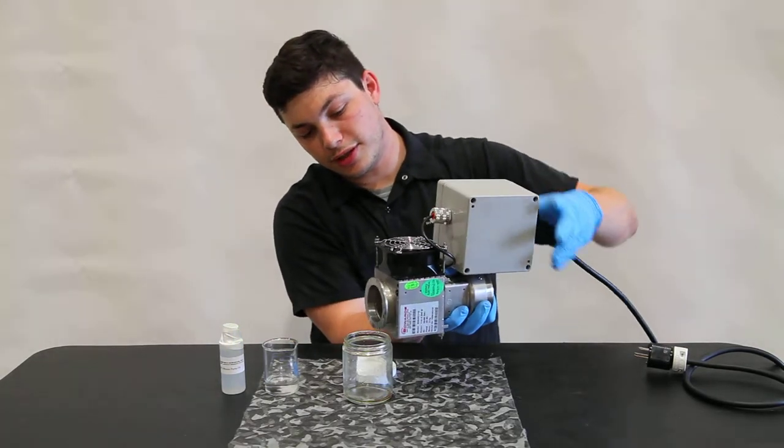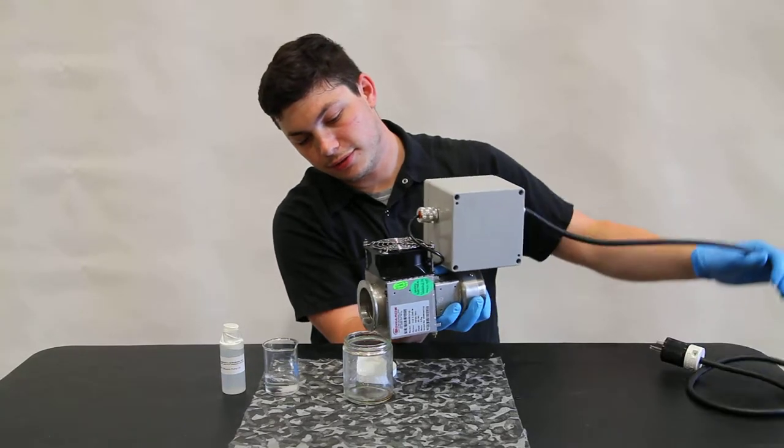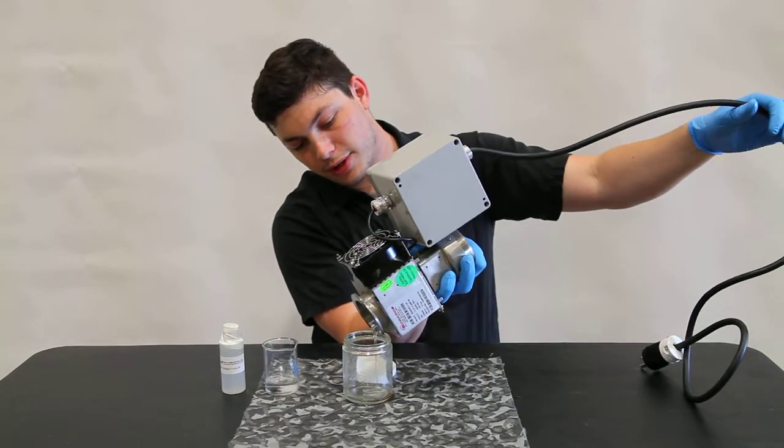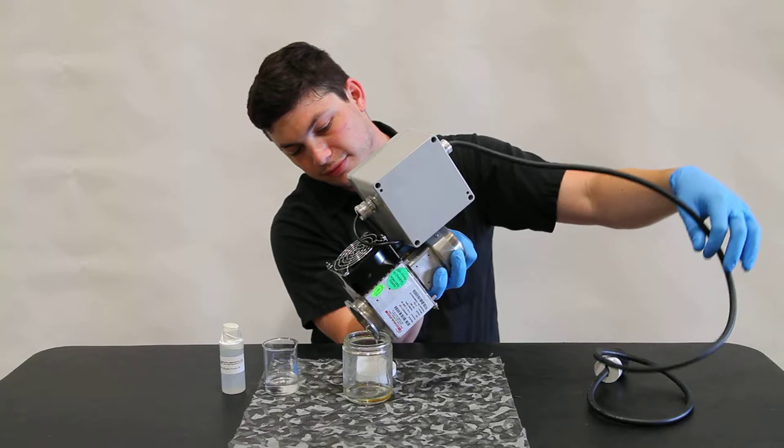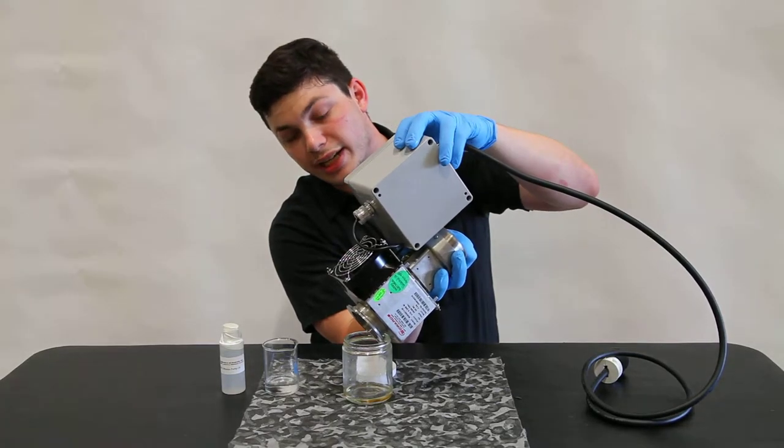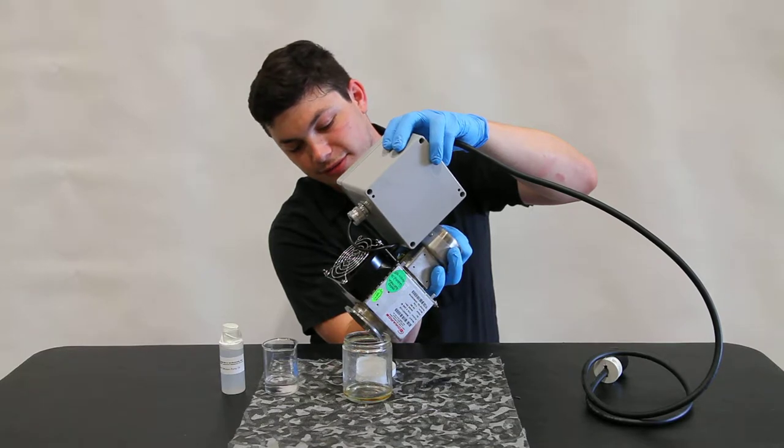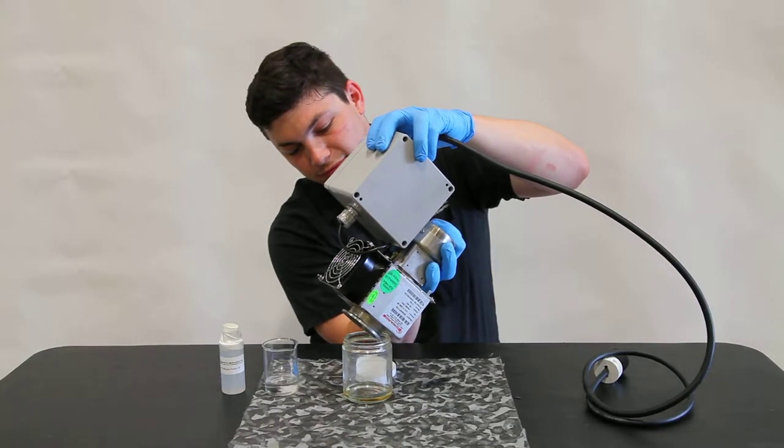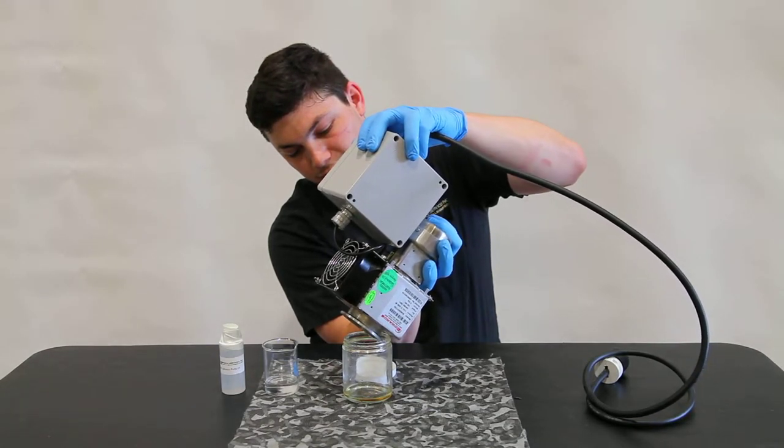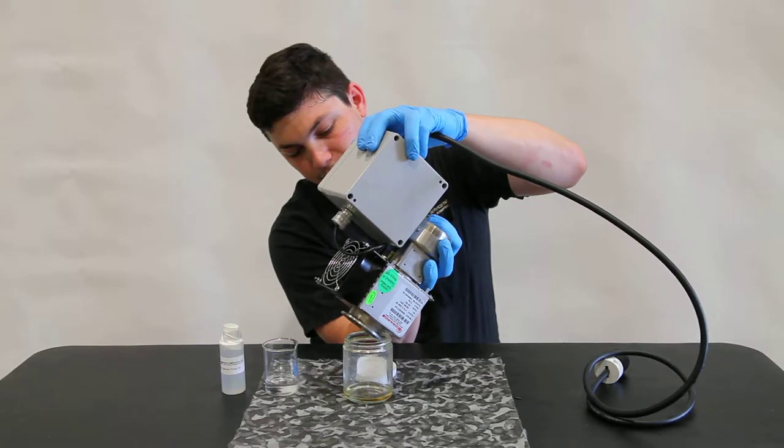and you'll see your diffusion oil start to pour out. It's usually yellow or black or something you don't want. Let that drip out as much as possible.